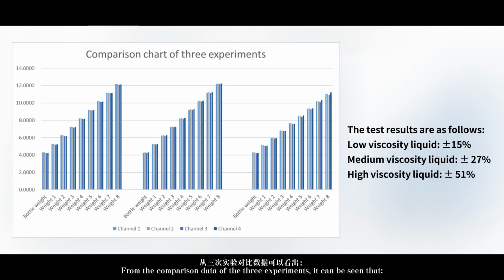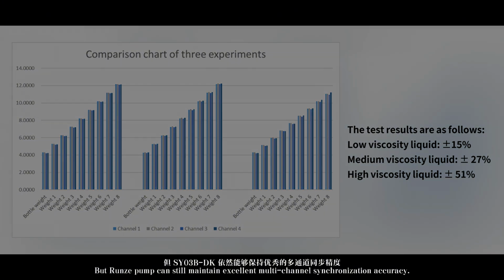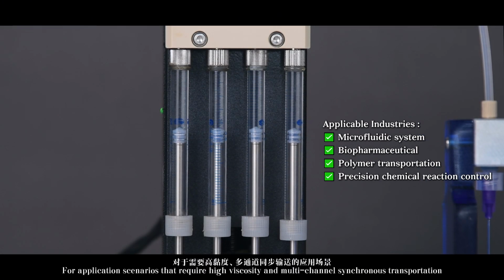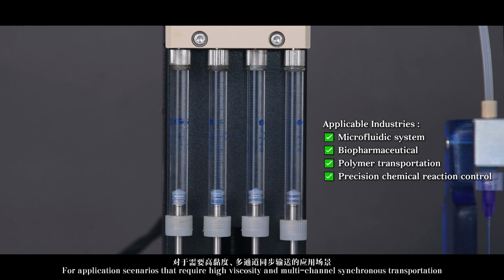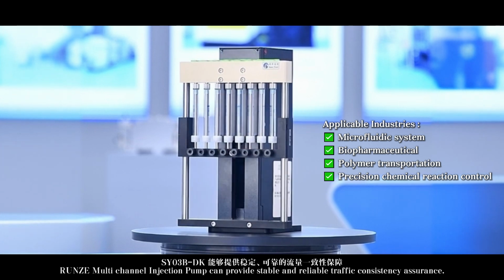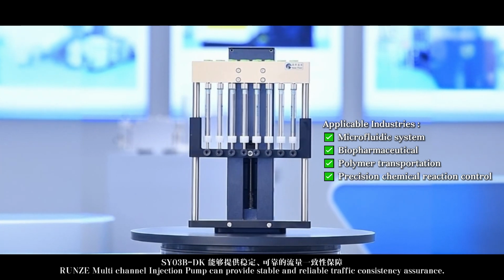From the comparison data of the 3 experiments, it can be seen that as the viscosity of the liquid increases, the system resistance does indeed rise, but the Runze pump can still maintain excellent multi-channel synchronization accuracy. For application scenarios that require high viscosity and multi-channel synchronous transportation, the Runze multi-channel injection pump can provide stable and reliable flow consistency assurance.